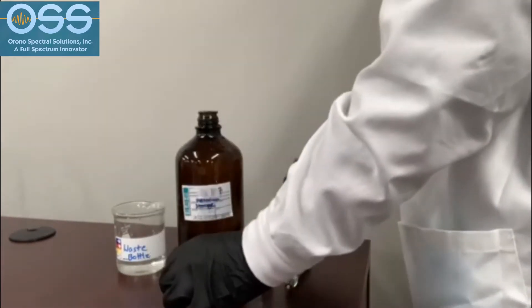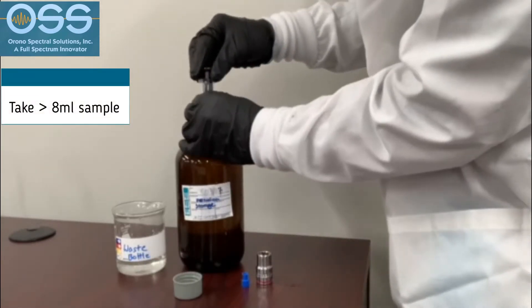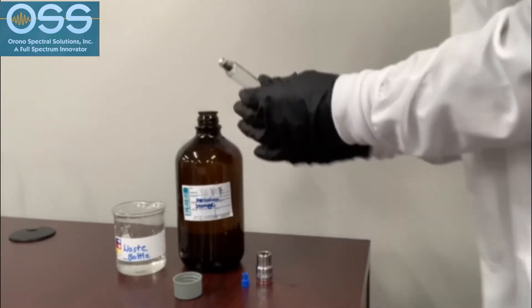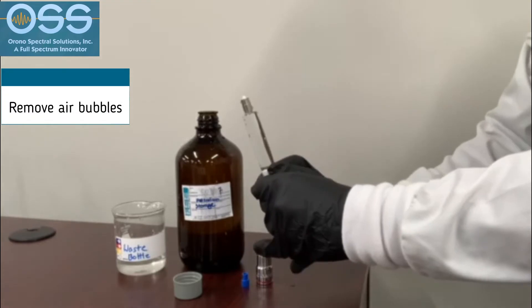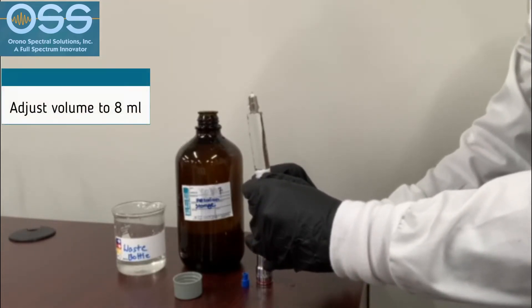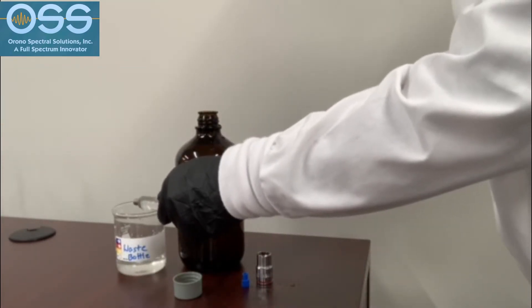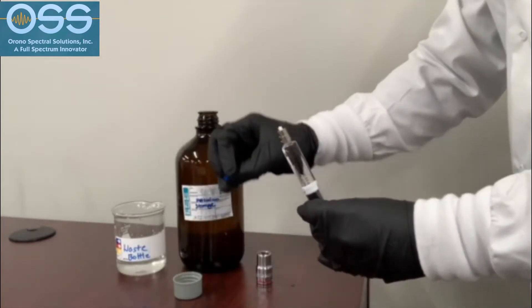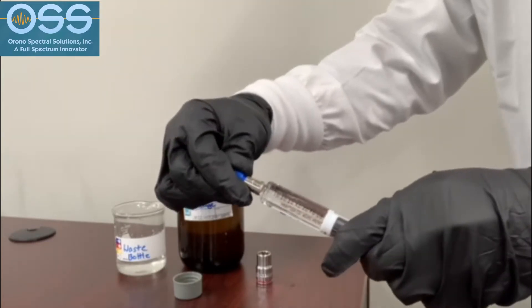Now it is time to extract more than 8 milliliters from the homogenized sample using the 10 milliliter glass syringe. Ensure that there are no trapped air bubbles in the bottom of the syringe, then adjust the volume to 8 milliliters. Once there are 8 milliliters in the syringe, seal the open end using the syringe end cap.